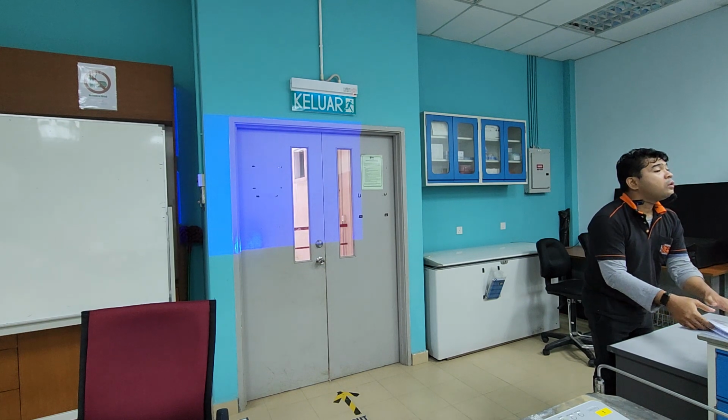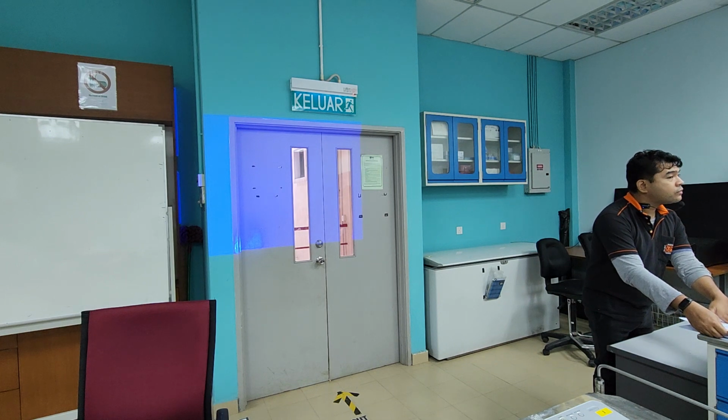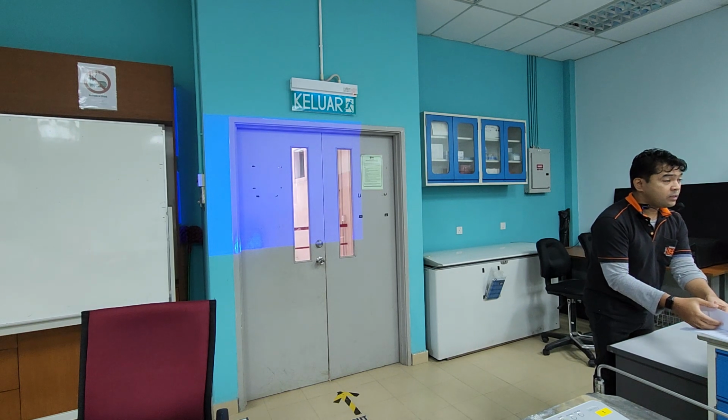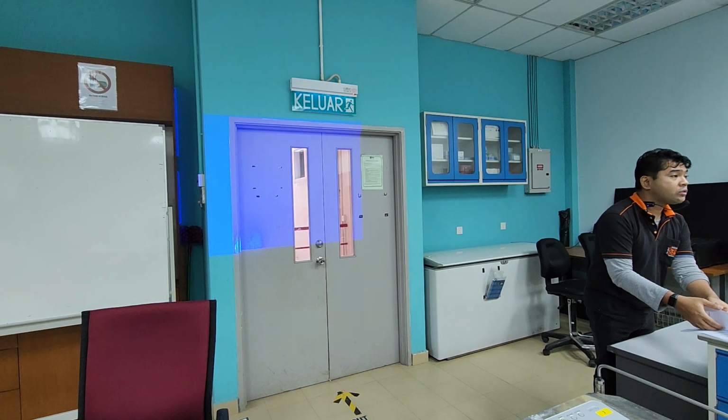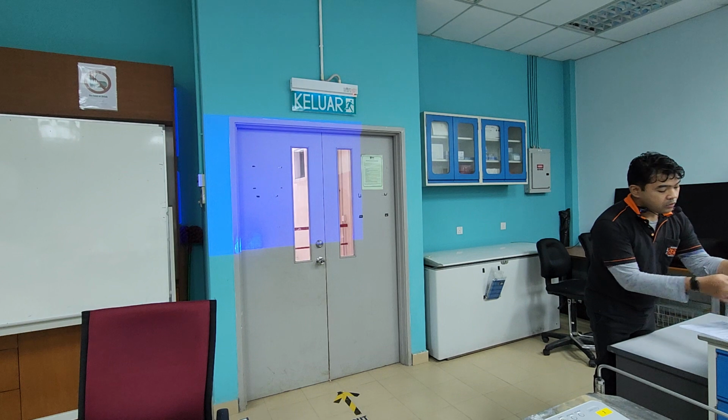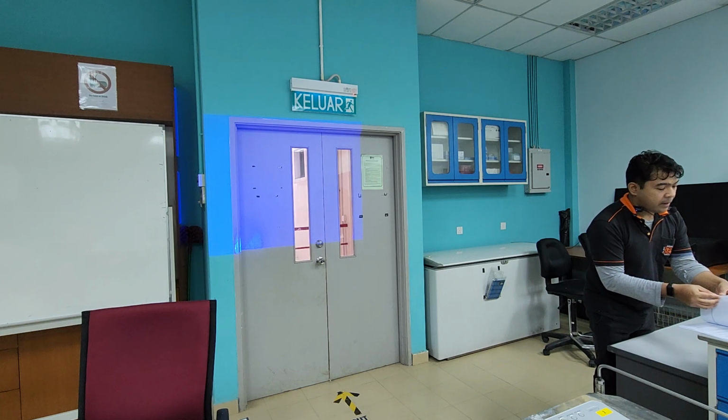Yep, week 3 and week 4. That's for the leaf area determination activity, right? For the second activity, the growth analysis, which is labeled as week 2 in your lab manual, we are going to be doing that afterwards.